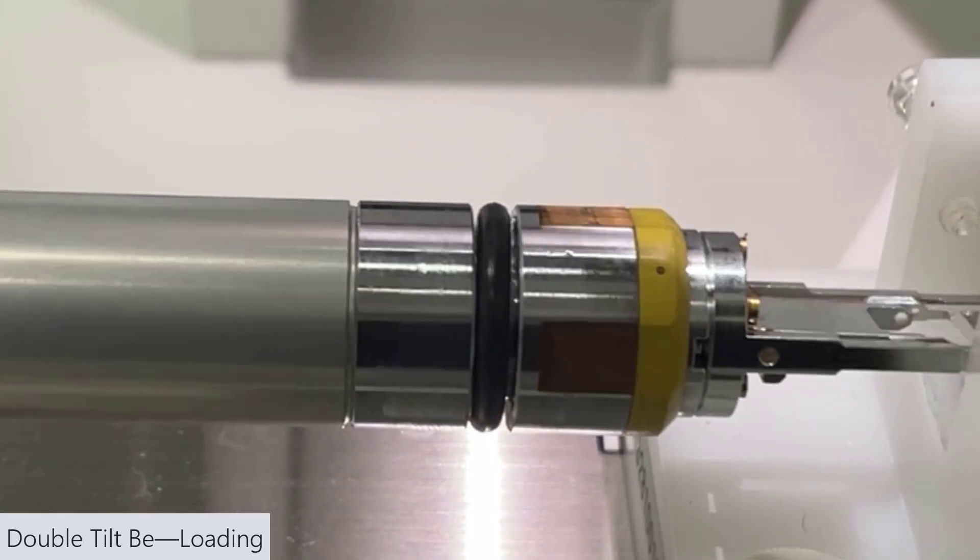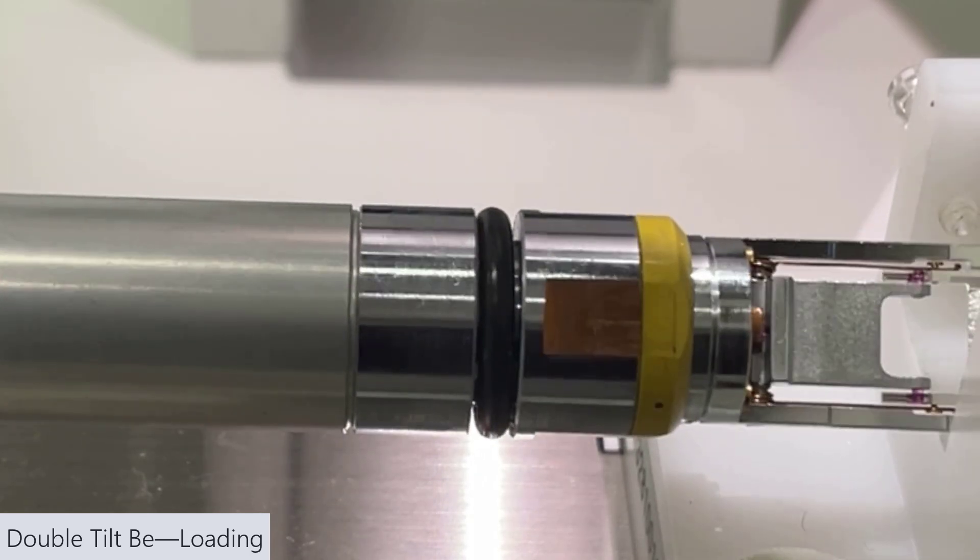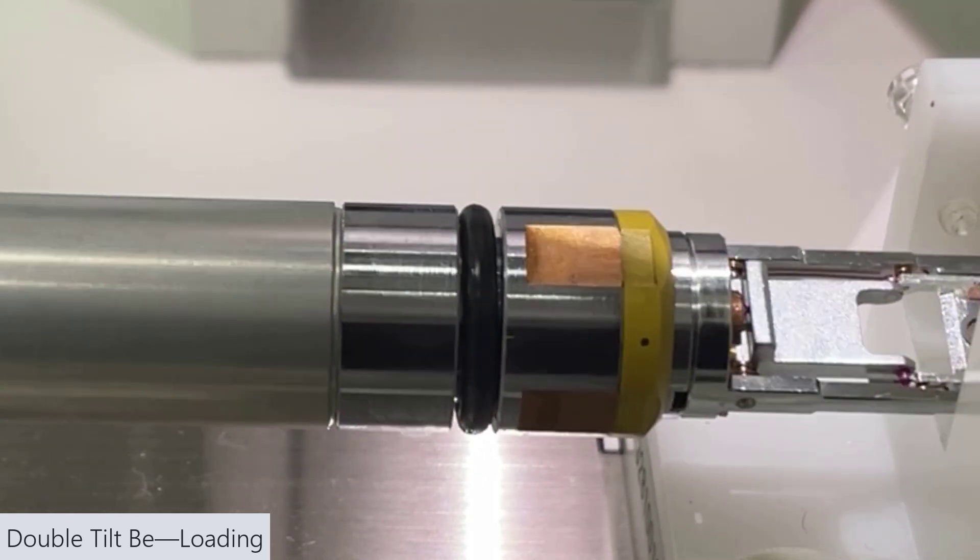Now, again, let's check the O-ring for any lint or hair and get it out of there.